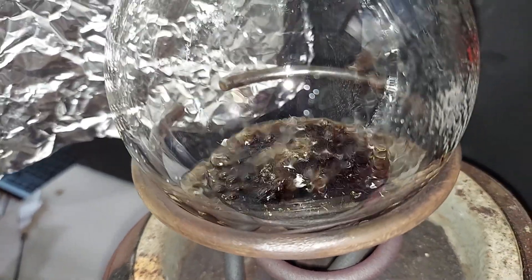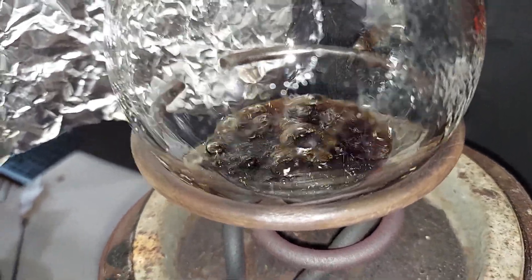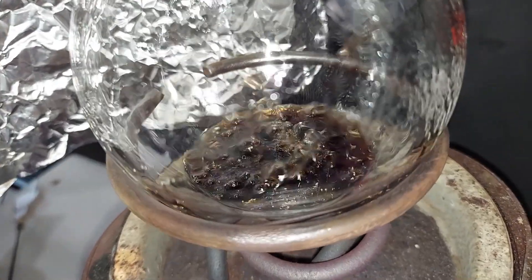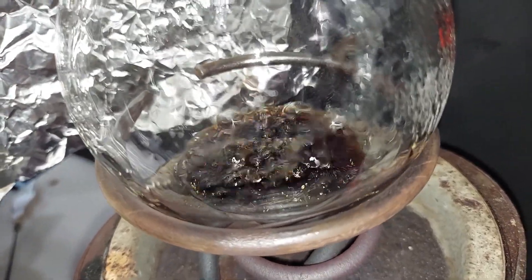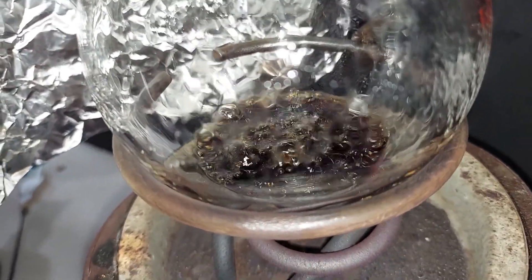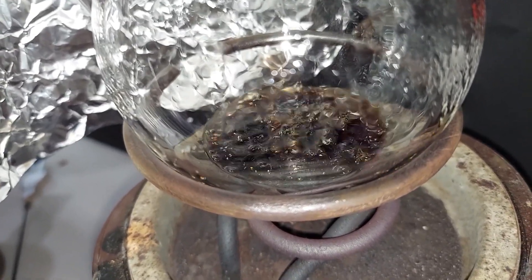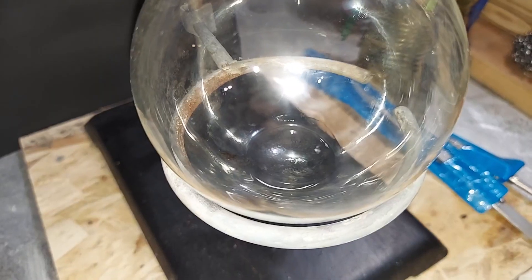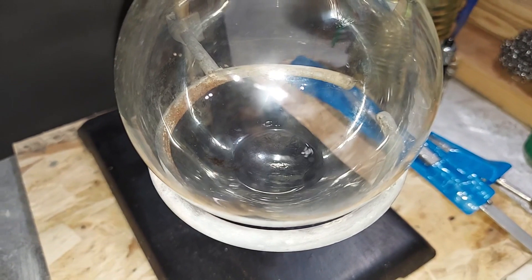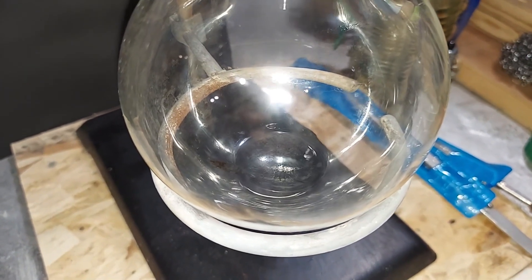After 10 minutes you can see the salicylic acid has liquefied — this is normal. It turns dark like this, and after some time, once the phenol has been completely distilled over, it becomes a black tarry substance that's a little hard to get off the glassware. The very first few drops of phenol are starting to come over.